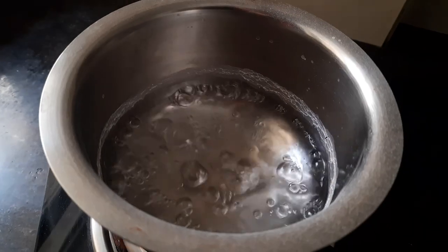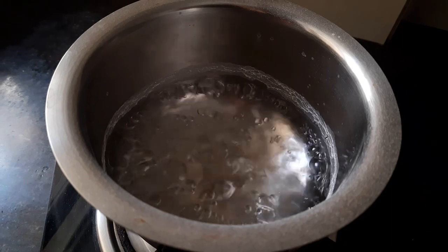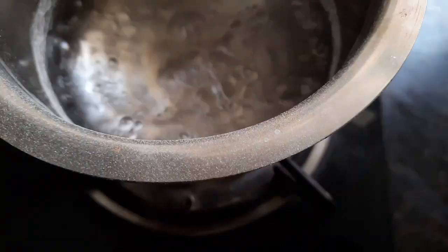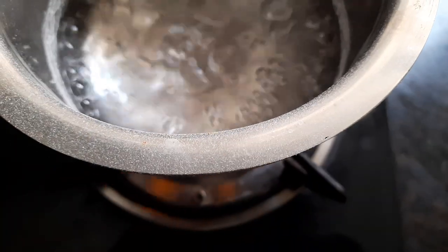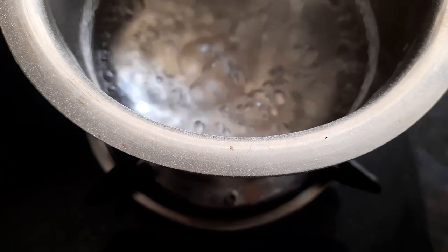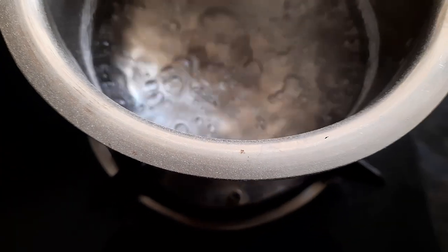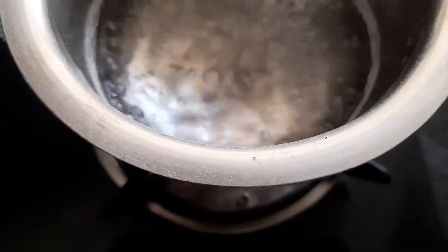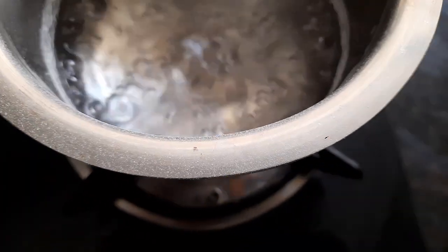Now notice what starts happening as the water starts boiling. Do you see the salt getting deposited on the sides of the container and also on the top of the container? Just like how you see in front of you.